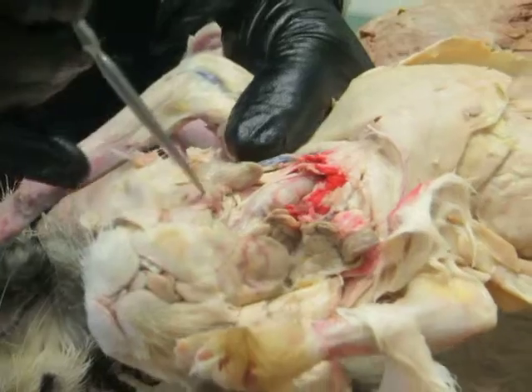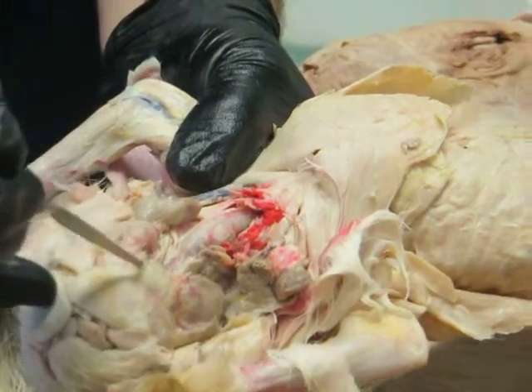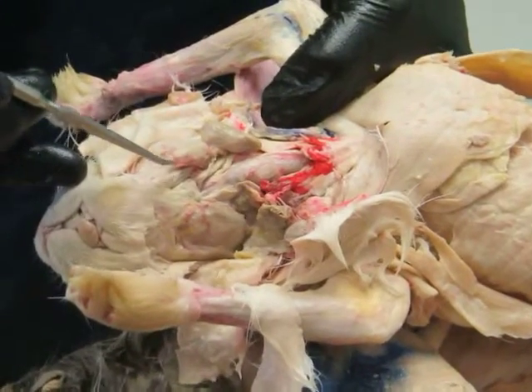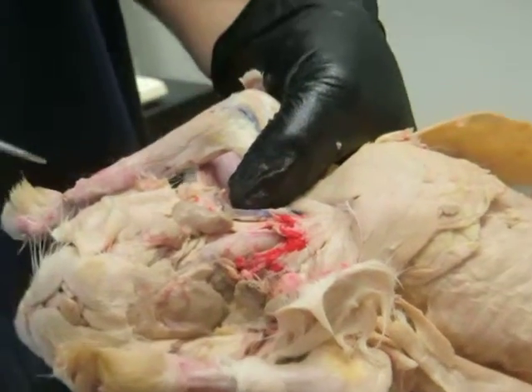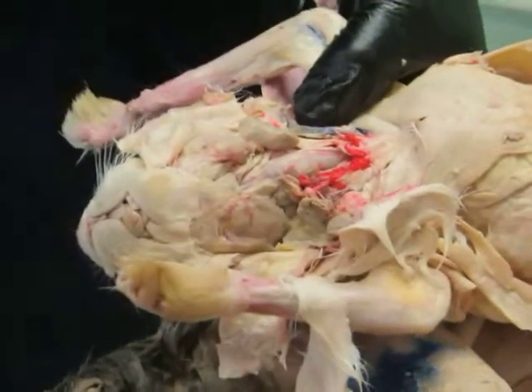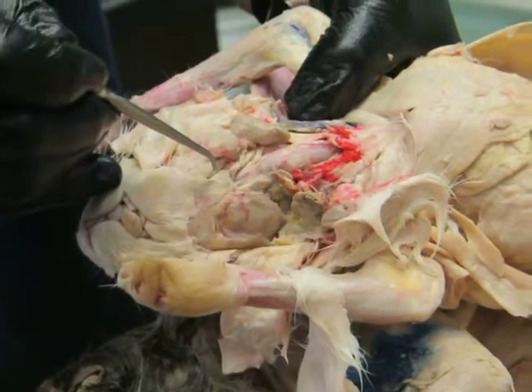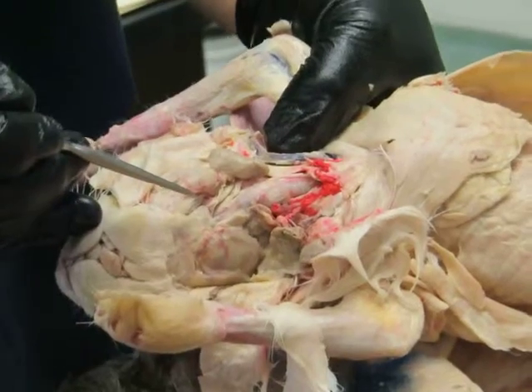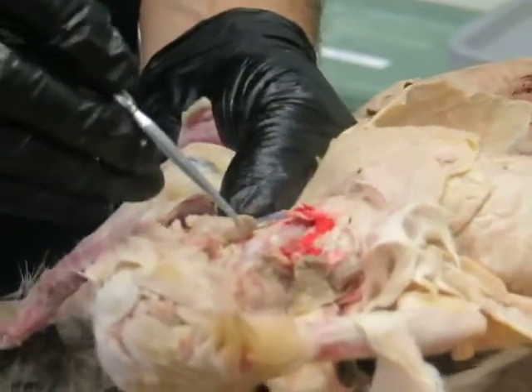In between the two masseters, you can see a pair of muscles that are running up like this, inside the rami of the lower jaw. Okay. And those are the digastrics. And digastric means literally two bellies, digastric. And in humans, this muscle has an anterior belly that's derived from mandibular arch musculature and a posterior belly that's derived from hyoid arch musculature, and a little tendon in between.